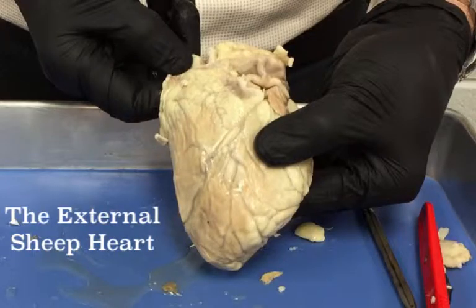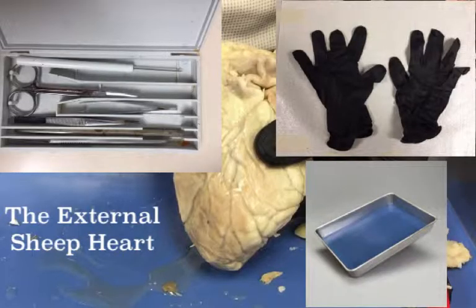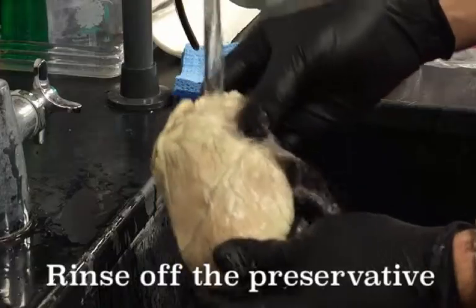In this video, I will demonstrate the identification of the external anatomical features of the sheep heart. The first thing you should do is have your gloves, dissecting kit, and dissecting tray ready. Once you are given a sheep heart by the instructor, cut open the bag and remove it. You can discard the bag in the trash.